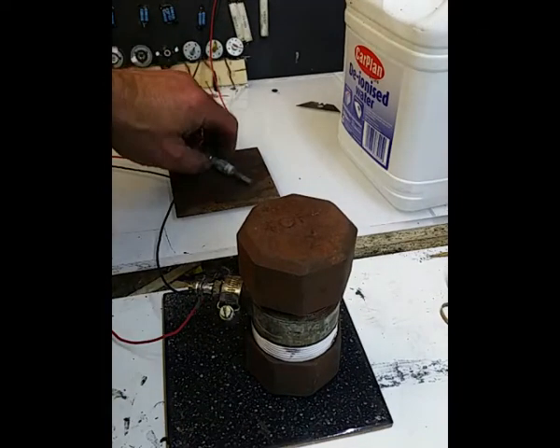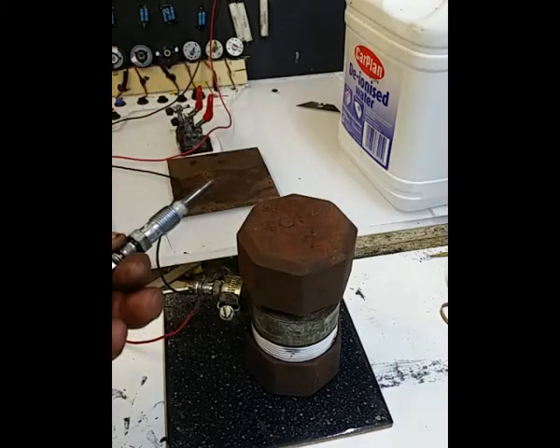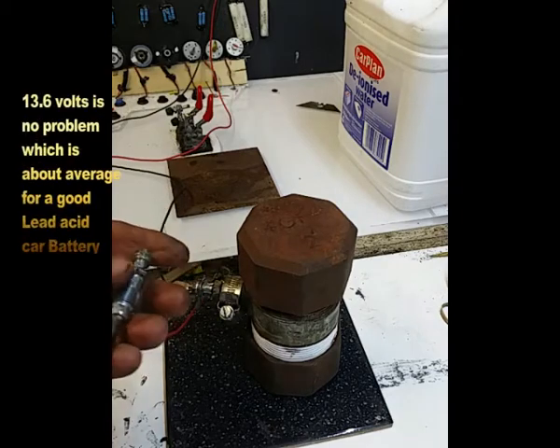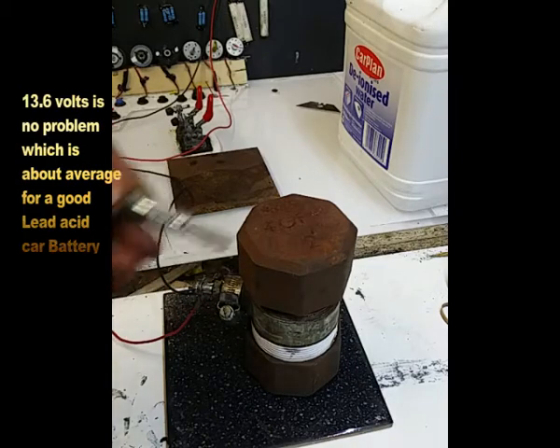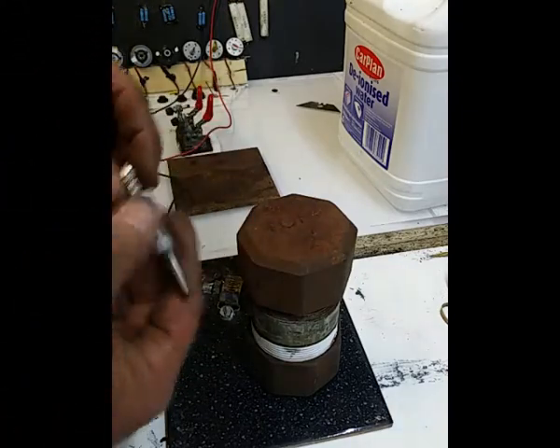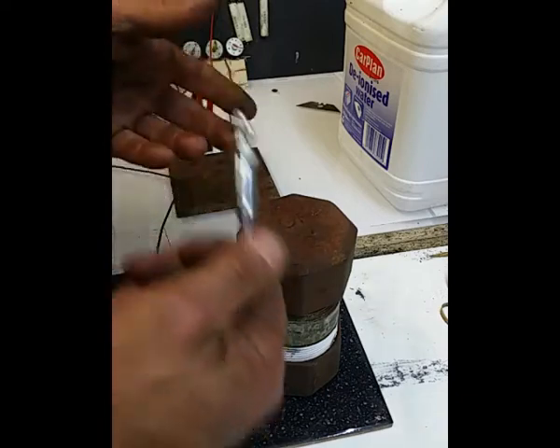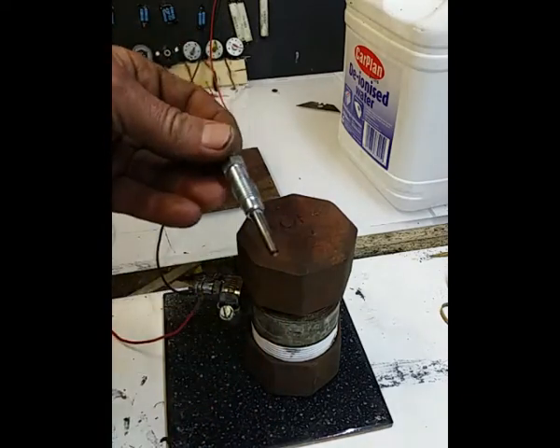Now obviously these things are good for, you know, up to 12 volts, I would, or even more, I would imagine, because they're fitted on 12 volt vehicles. And I would imagine that when you do your preheat on the diesel engine, the glow plug is at 12 volts. So yeah.